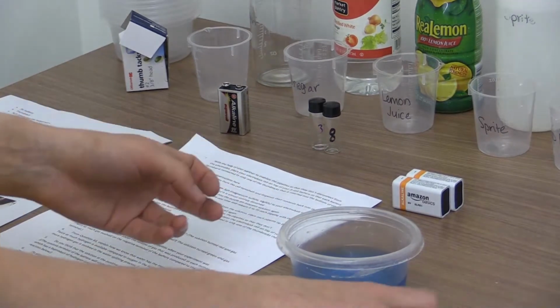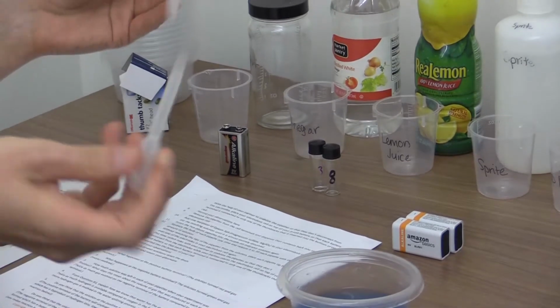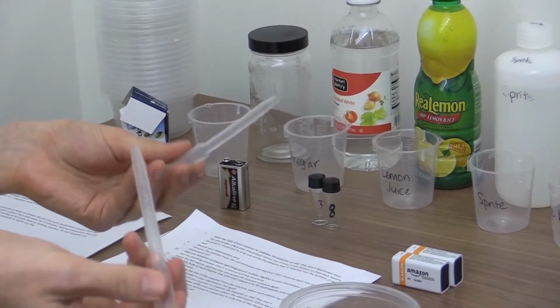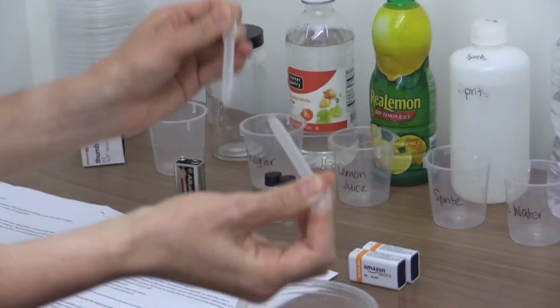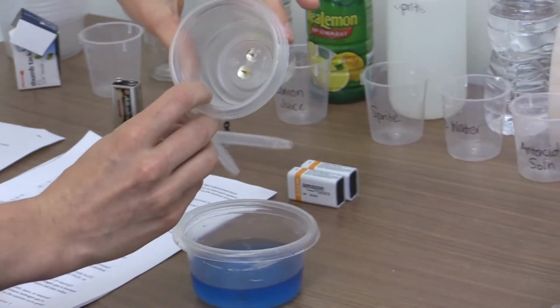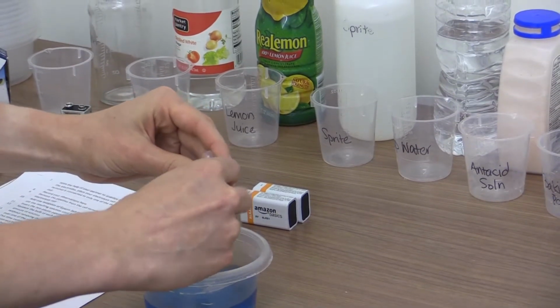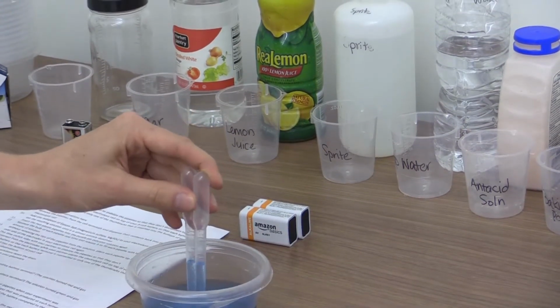they're going to take 2 plastic transfer pipettes, and you can cut off the ends so that it has a little bit of a wider opening at the base, and that way it has a better opportunity to catch the bubbles that are being produced. They're going to put these over the thumbtacks that are in the bottom of the dish, and you want them to squeeze and suck up some solution so that the electrodes are at an even level.